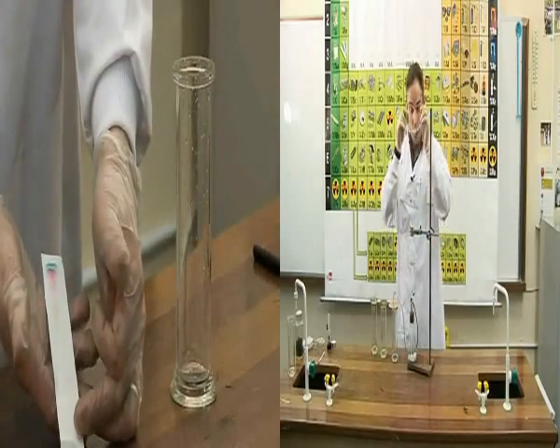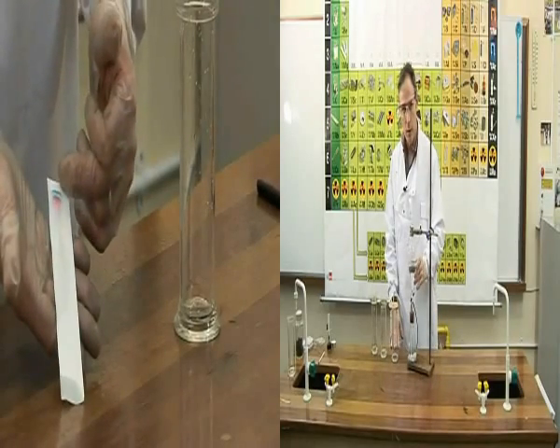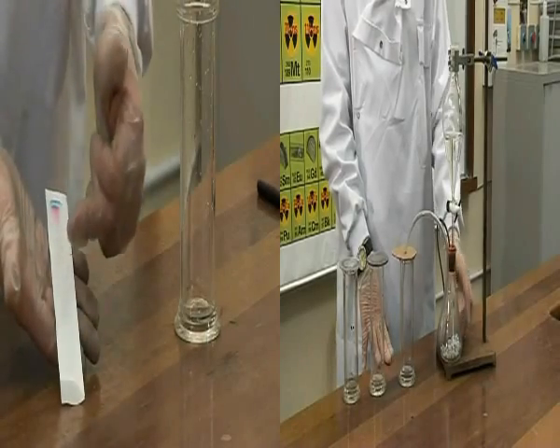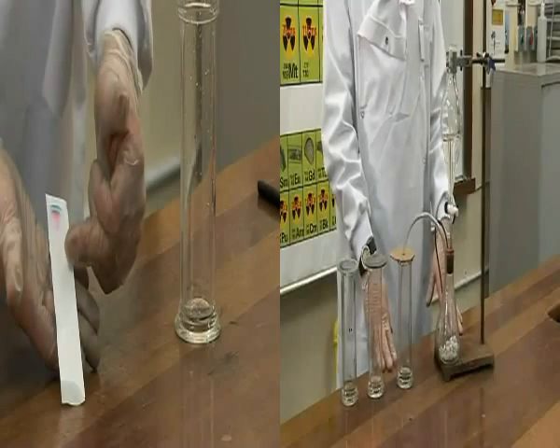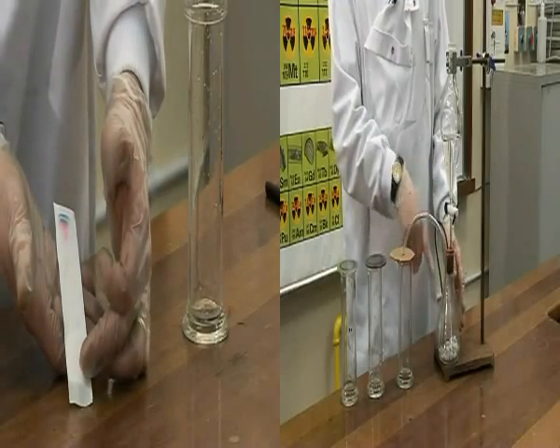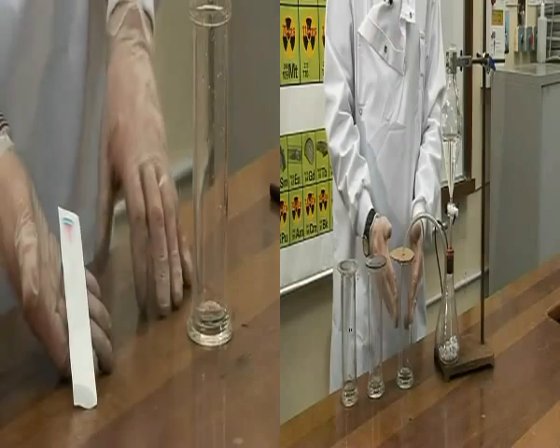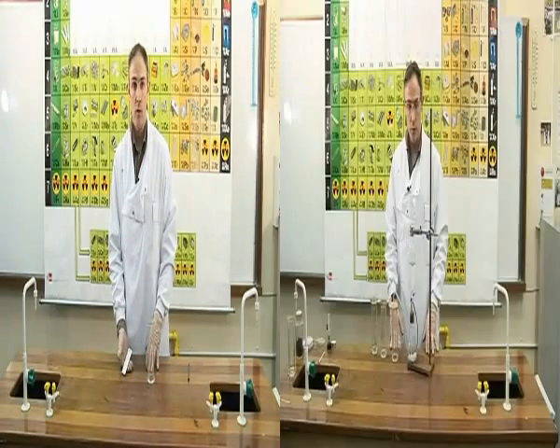The dot which we placed at the bottom has disappeared, and we can see that there is an orange streak followed by a red, and at the top is a bluish streak. The separation was caused because these three colours have different solubilities. Orange was the least soluble, and blue was the most soluble. As a result, we can determine that the black marker I used initially was composed of three colours: orange, red and blue. That is the end of experiment OC2D.